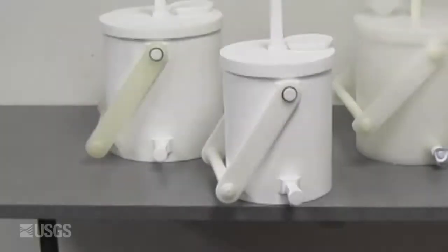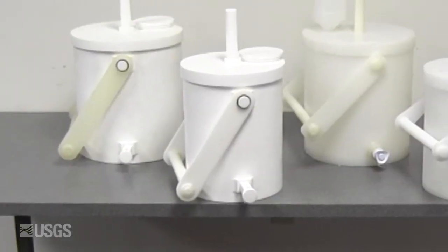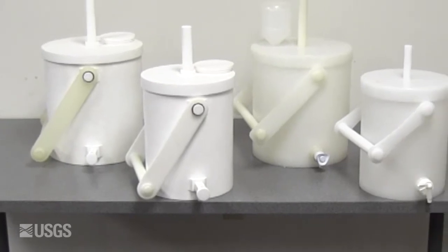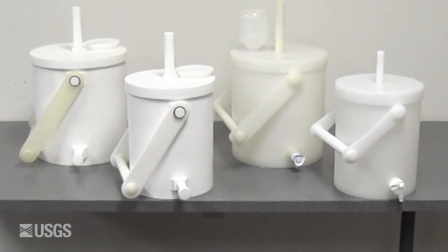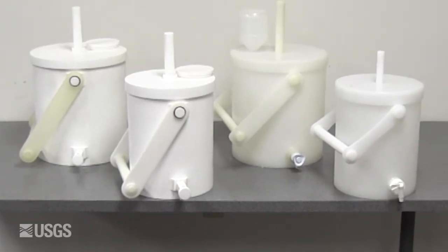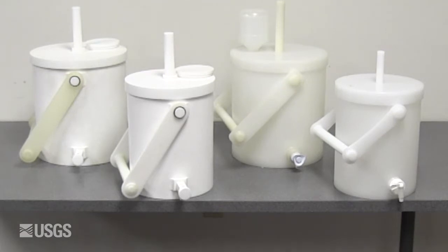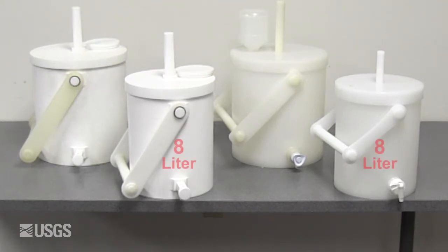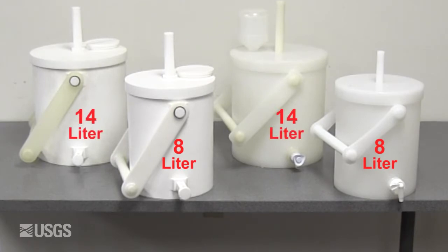This video presents the types, limitations, and operation of churn splitters. Churns are simple to operate, easy to clean, constructed from polymer or plastic material, and available in 8-liter and 14-liter sizes.